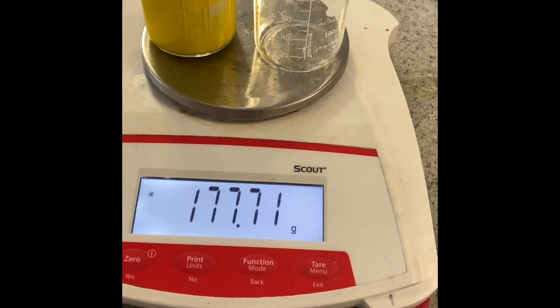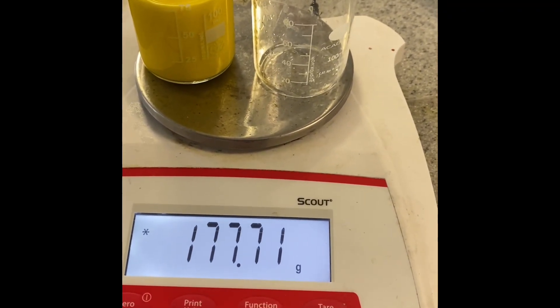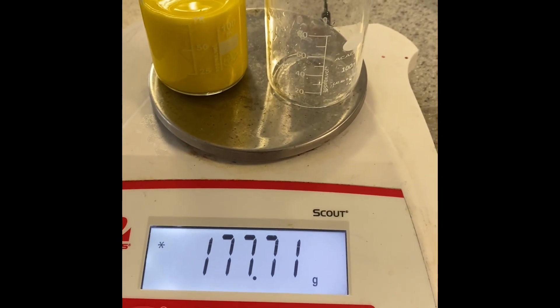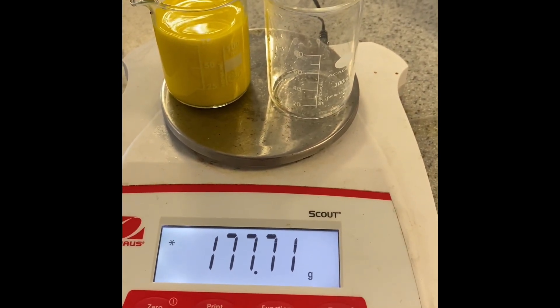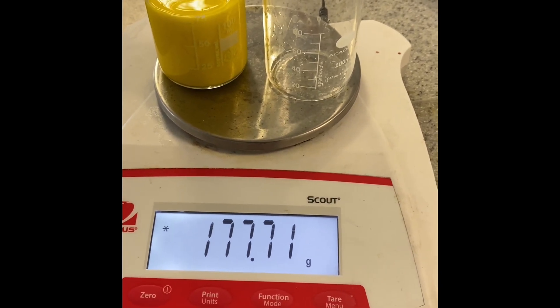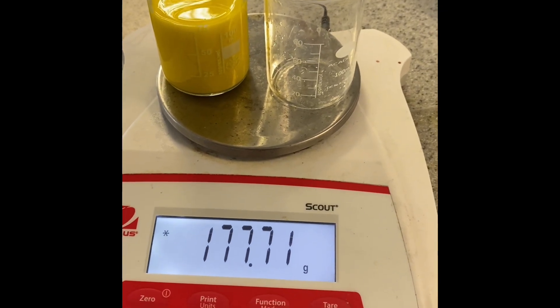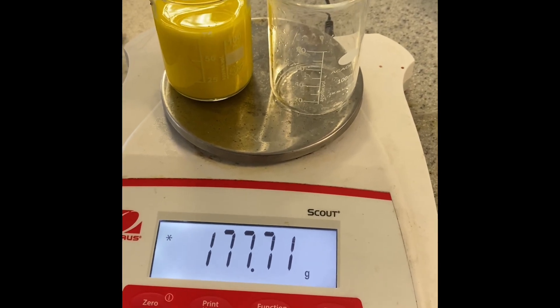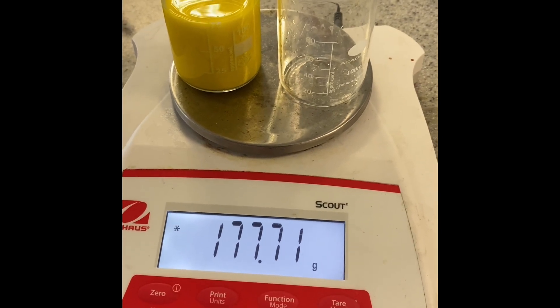Now if we look at the balance, it was 177.71 grams to begin with, it still reads 177.71 grams. And that highlights a really important idea in chemistry — the idea of conservation of mass. In a chemical reaction, regardless of what things are reacting together, the total mass of the reactants at the start is always exactly the same as the total mass of the products at the end. The mass in a chemical reaction is always conserved.